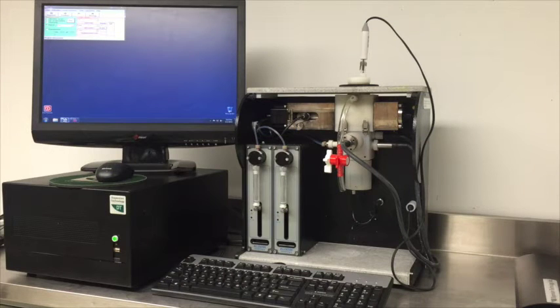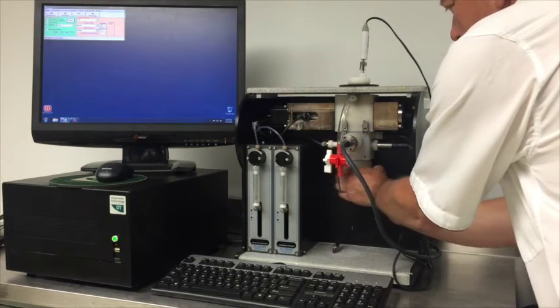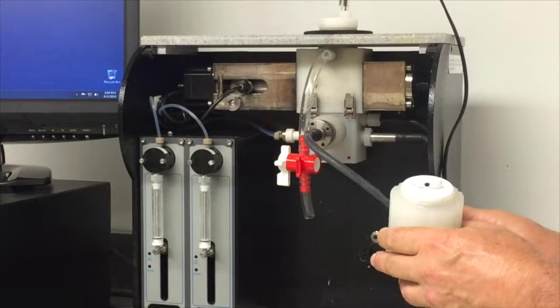Decades of experience dealing with concentrated samples has led us to develop a variety of sample handling setups to better accommodate the wide variety of concentrated samples the DT instrument can measure. The setup that you can see now is suitable for rather dilute, low viscosity samples. The magnetic mixer that is placed on the bottom of the sample chamber cannot stir heavier, more concentrated samples.